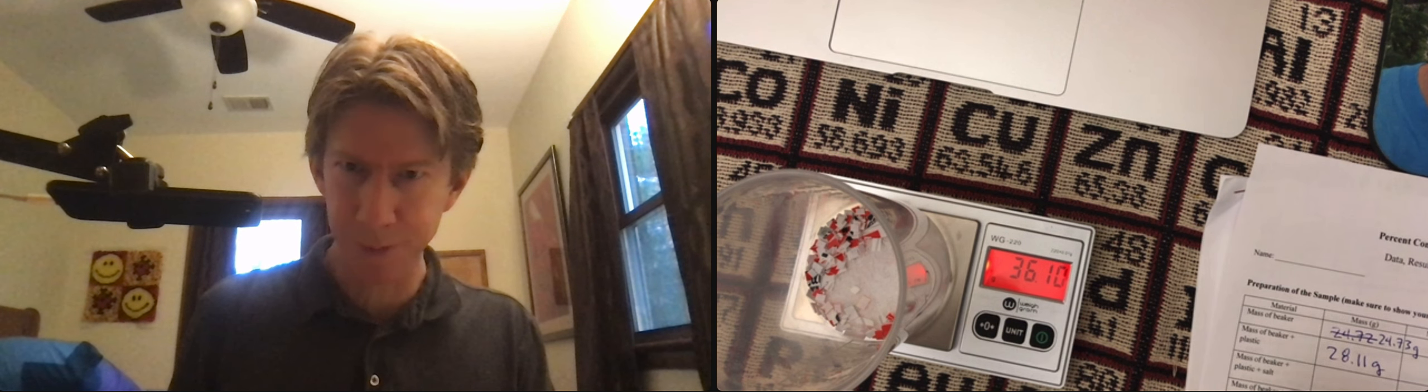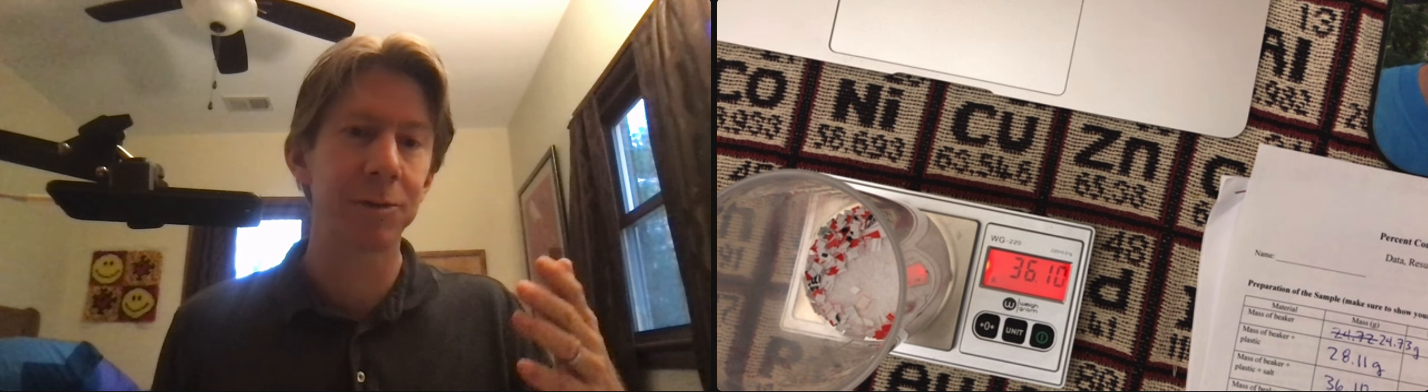Wait for the little circle to appear. I get 36.10 grams. You can see it's about eight grams. The exact mass doesn't matter, meaning it could be anywhere from 8 to 12 or 6 to 14.